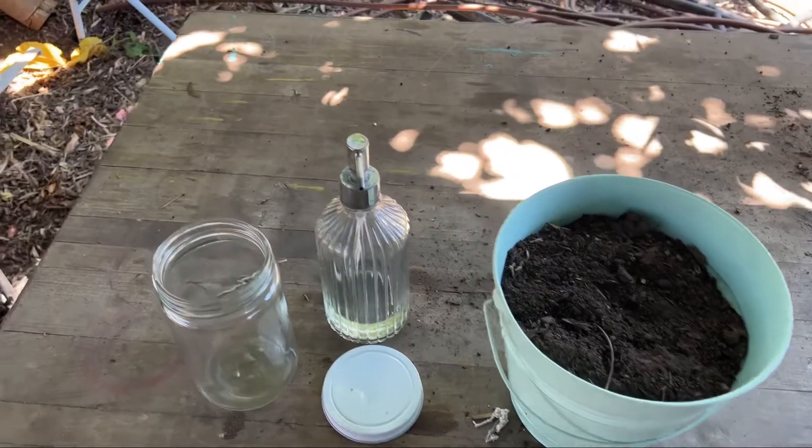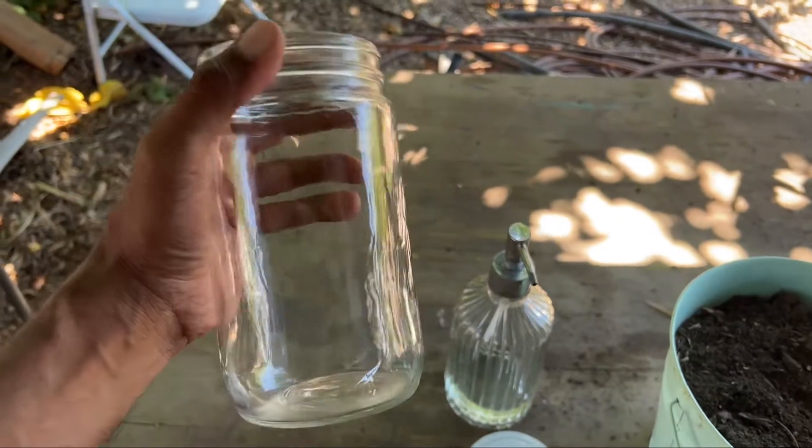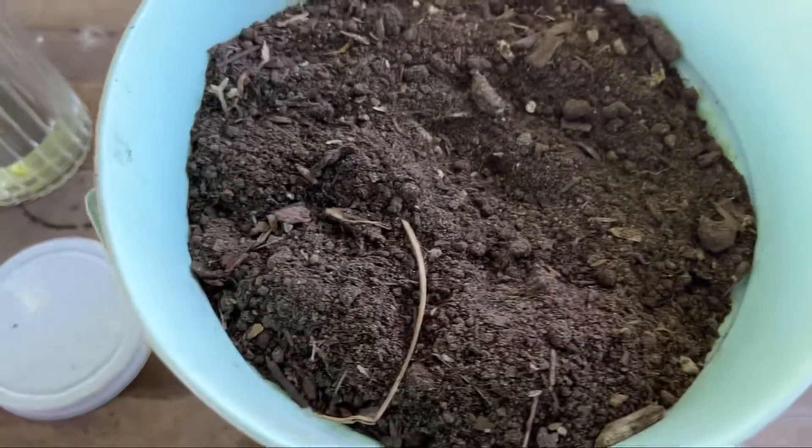The last thing you can look at is just the soil type — they're going to tell you that in the test. But I'm also going to do one more thing now that we took this soil sample out, just to show you how you can actually figure out your soil type for yourself. For this next part you're going to need a glass jar — I like to use glass because it's clear, plastic is not as clear and we're going to be looking into the jar. You're going to need some dish soap and then your aggregate soil sample.